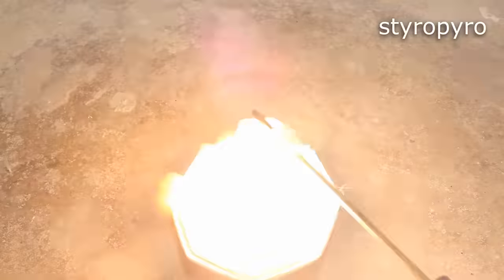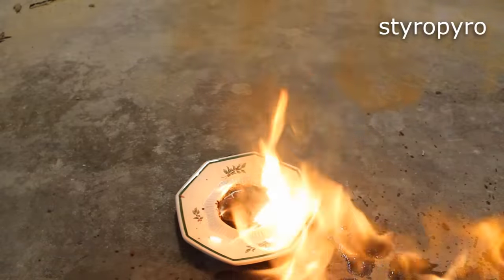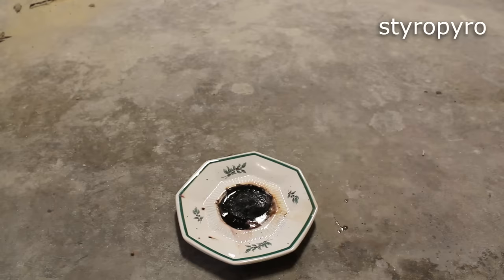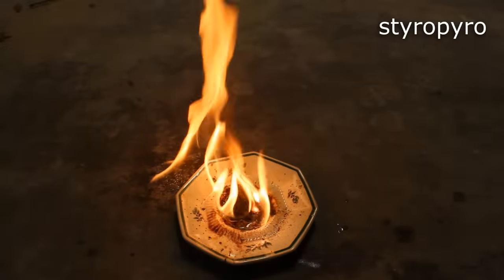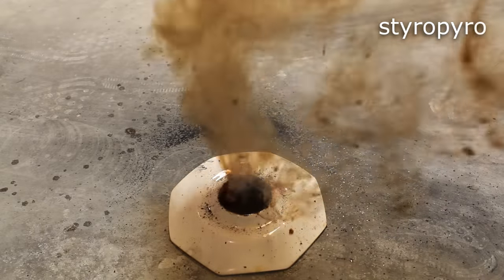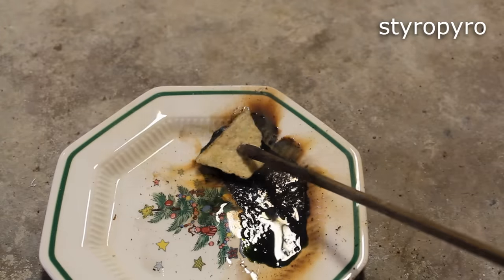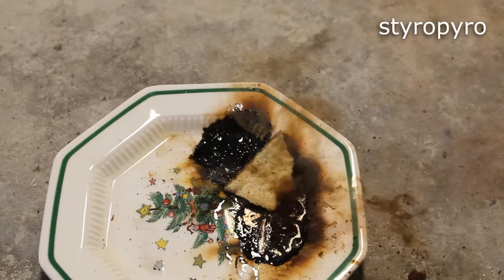Here I have a paper towel. Let's try it with some acetone. Hmm, I wonder if there's any left. Yeah, I'll take that as a yes. Some sugar. All right, let's see what it does to a potato chip. Oh, there it goes. Some charcoal.